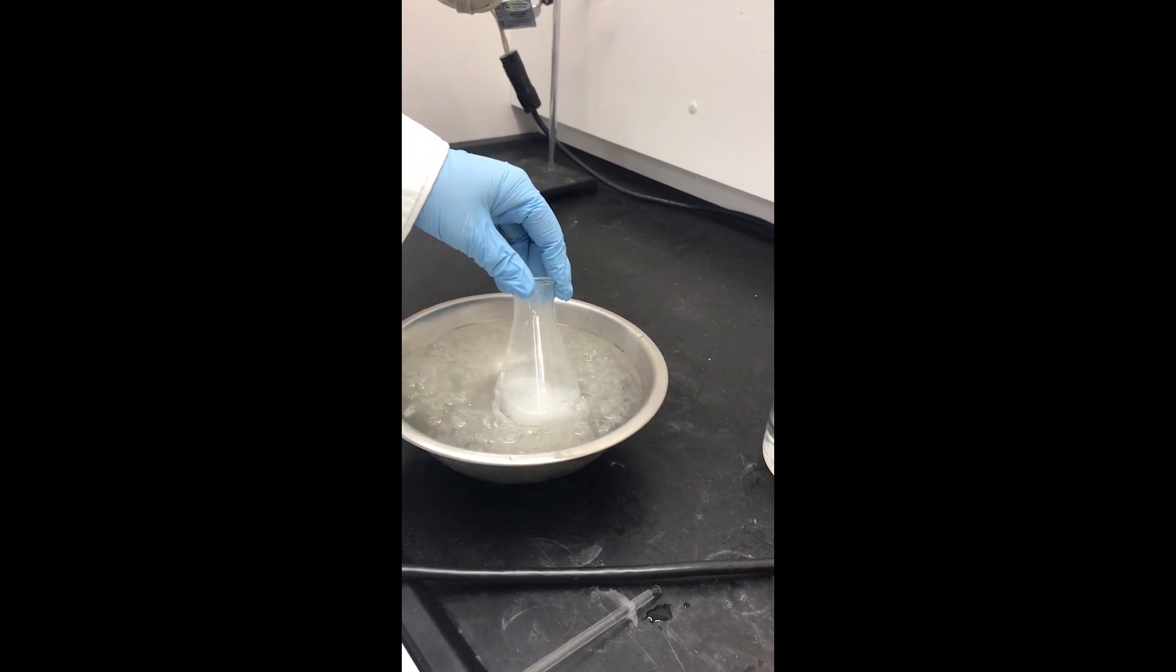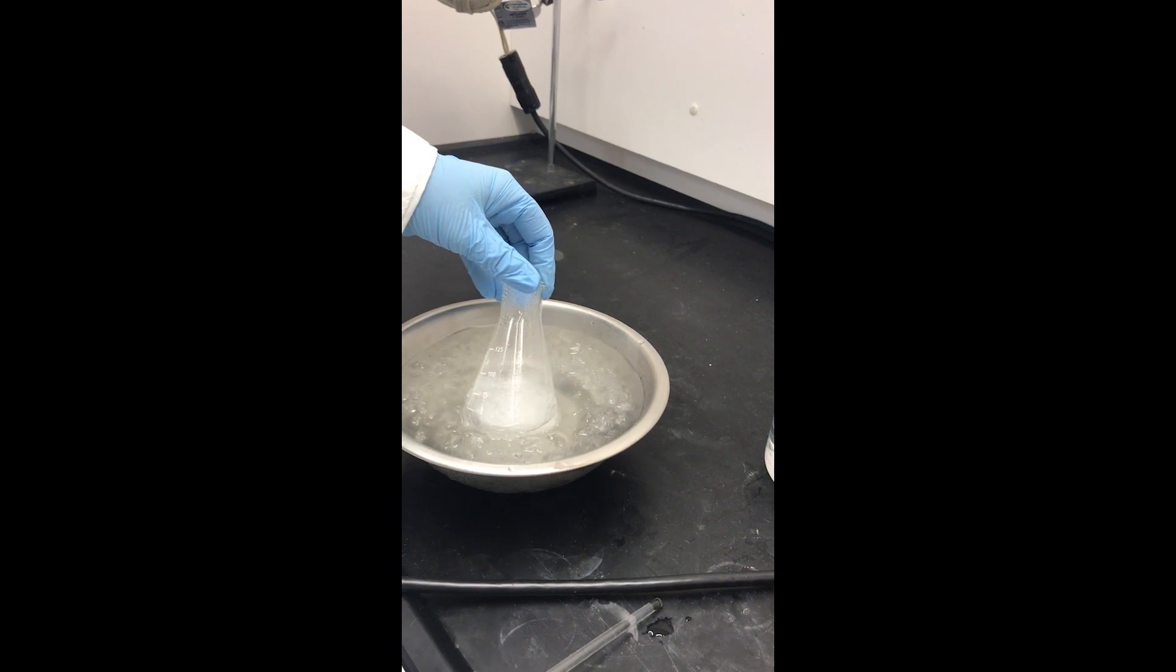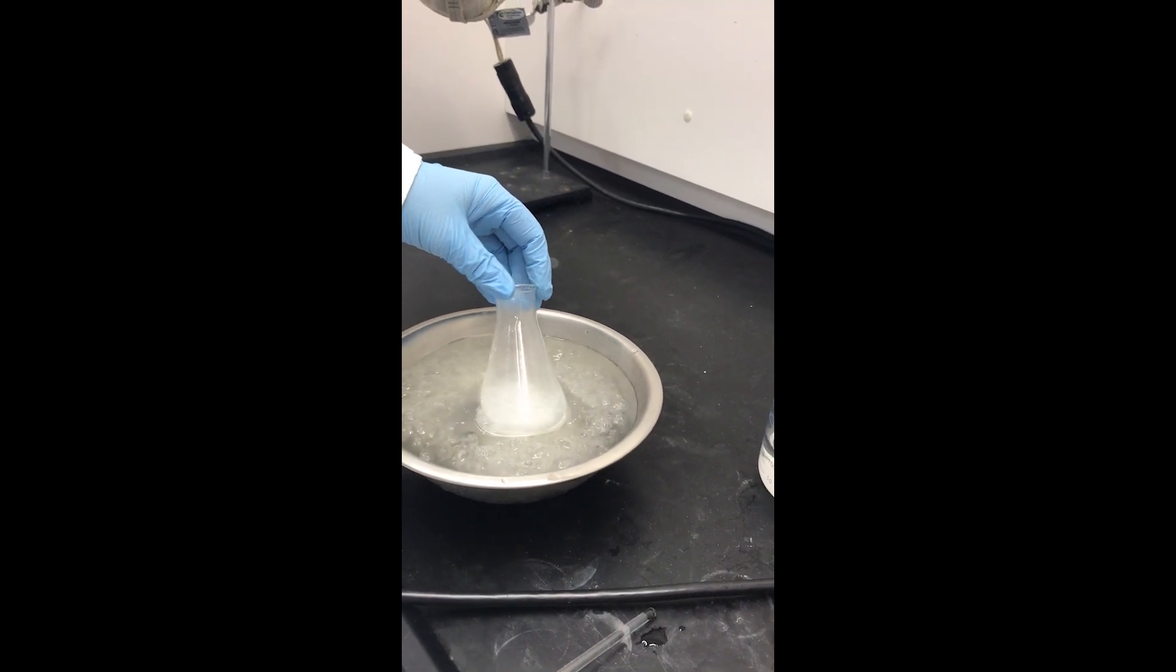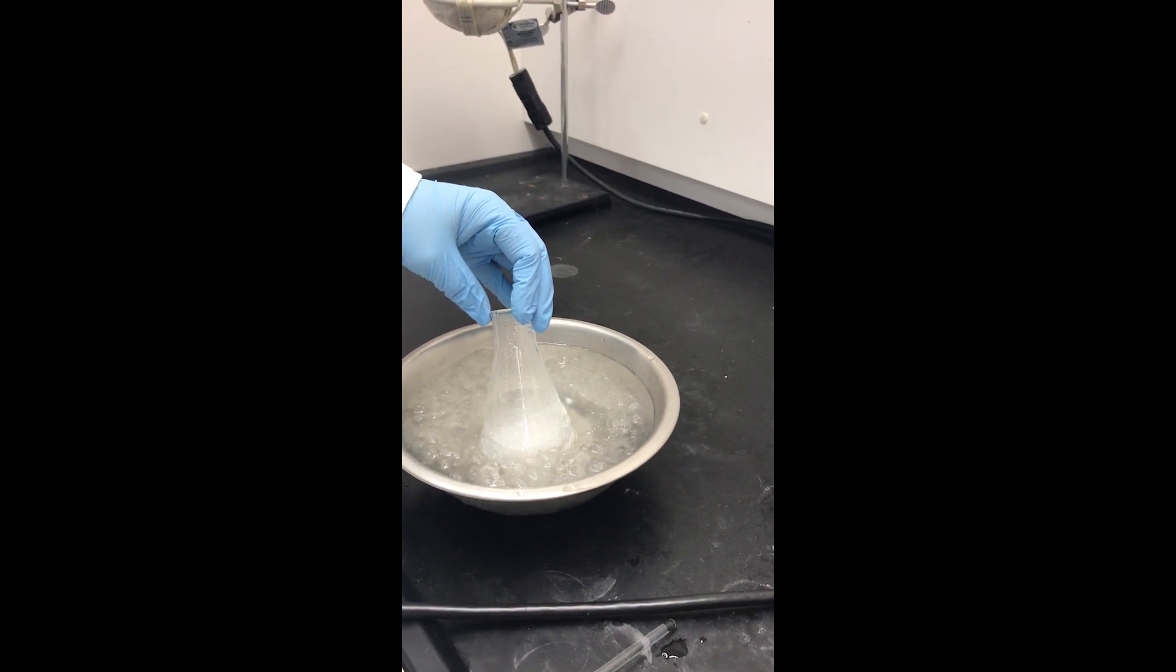So that's the process of recrystallization. From here, you would do a vacuum filtration to collect the crystals, and you can watch that video. I did a vacuum filtration video separately.